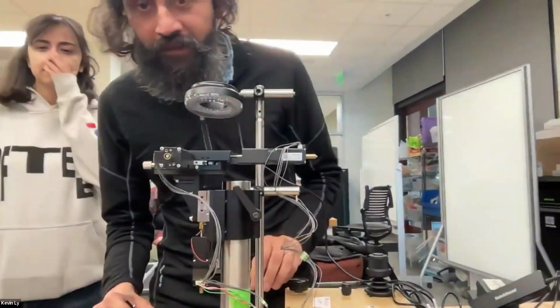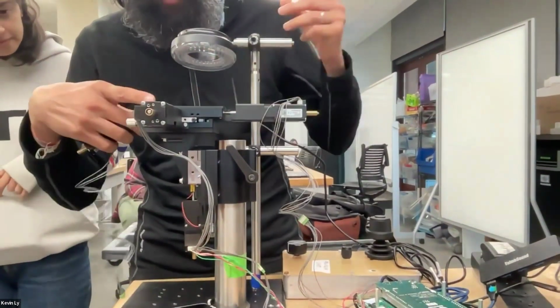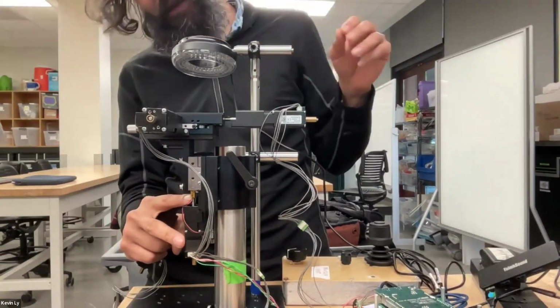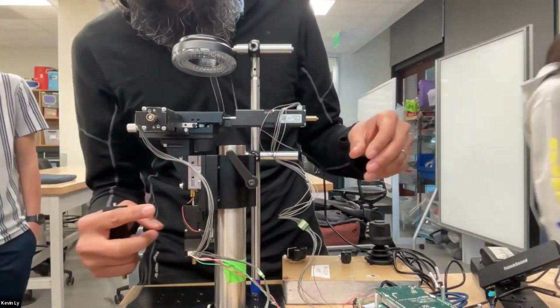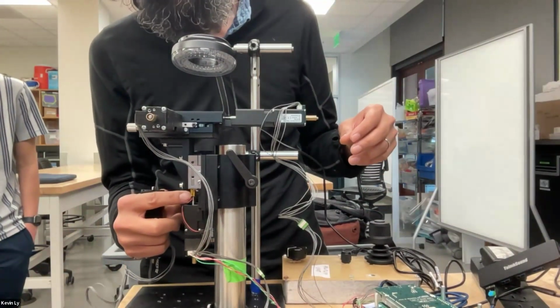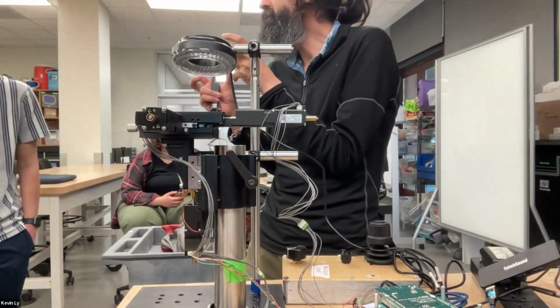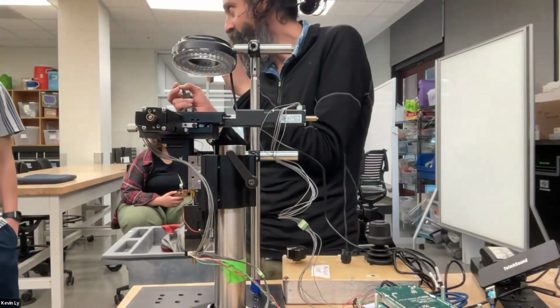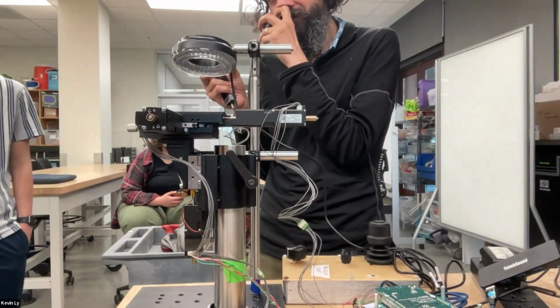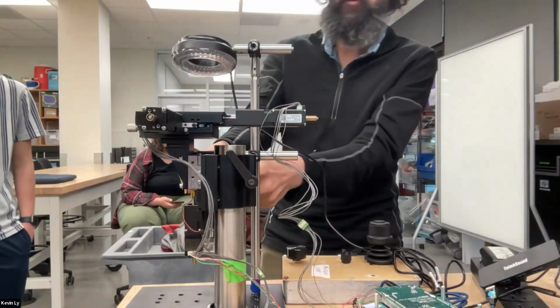So everything is good. This motor is very similar to this motor, which is on these two parts. But for Z, we added a special component here, which is this tiny gold block. It's not gold, so yeah. So what do you need in the Z axis that's different in a microscope that you don't need in X and Y? Don't you also need to connect back to the actual optical component? Yeah, the optical component is mounted here.